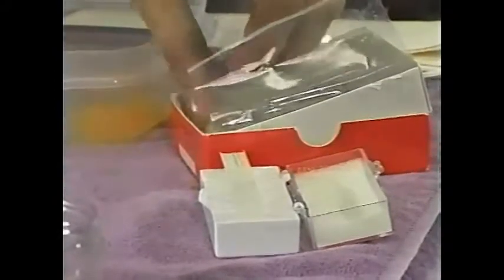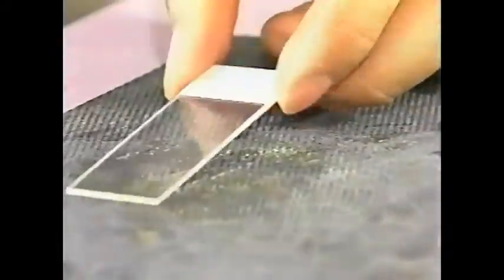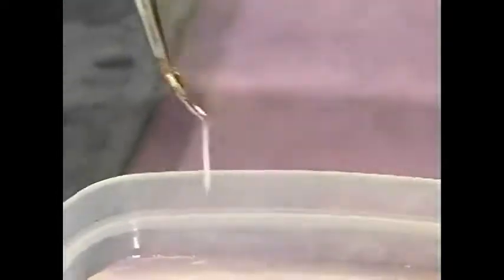This section is actually very important — it's cleaning that albumin off. Once you get that membrane off, it's pretty tough and sturdy. Most of the time when people do this, they don't shake it enough or clean enough of the albumin off. I will shake it, release it, shake it, release it — you want it to look very clear. It's easiest to do this on a dark tabletop or background, like the back of a mouse pad or a felt-type paper from a craft store. Once we get that membrane shaken off and the albumin removed, we'll reach in with a pair of forceps, pull it out — see how thin and stringy it is — confirming we've gotten most of that albumin off.